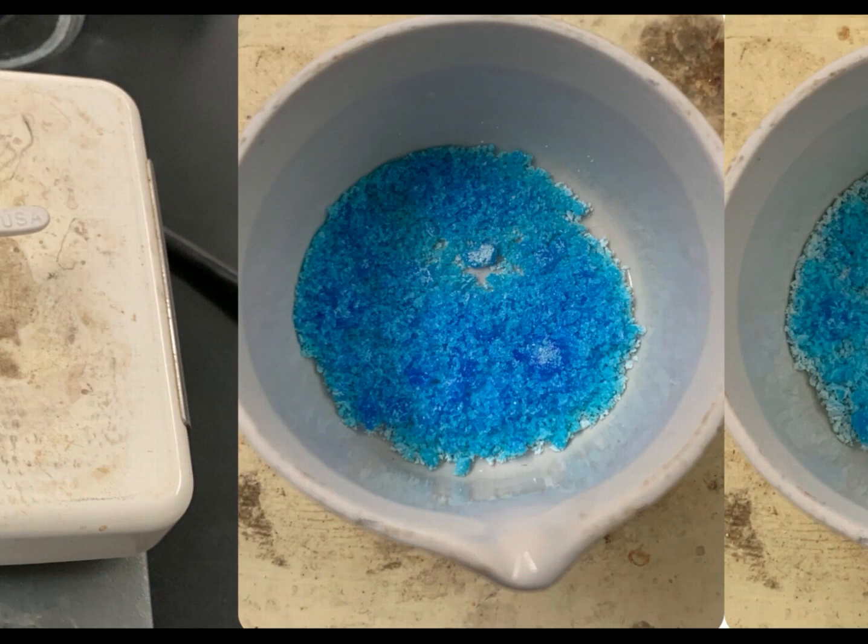As you heat it, the water is going to go to the gas state. It's going to be vibrating like crazy, and it's basically going to vibrate to the point that it crashes its way out of the lattice. That's going to make that crystal lattice and that beautiful geometry kind of fall apart, and it becomes an amorphous solid, which we refer to pretty much as just a powder.